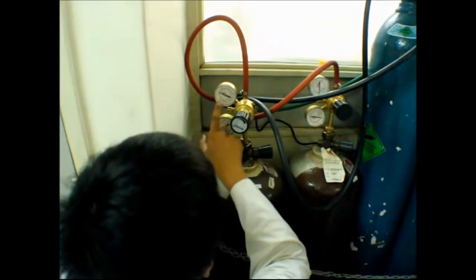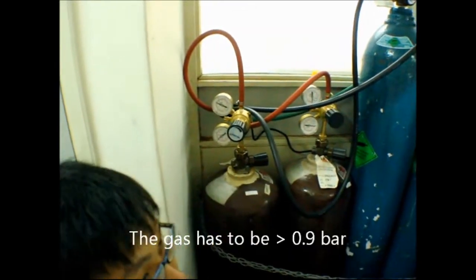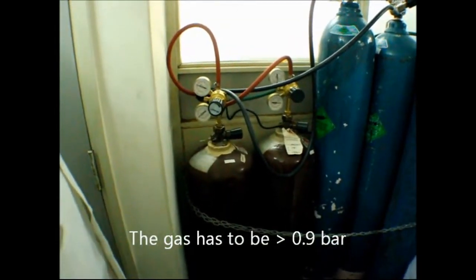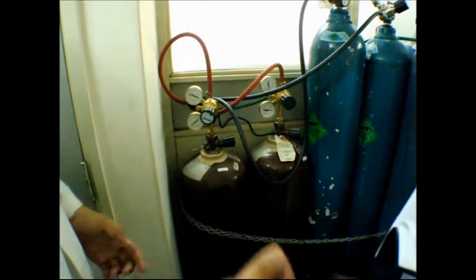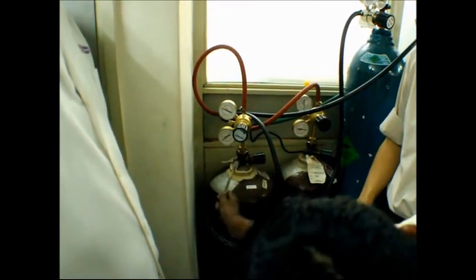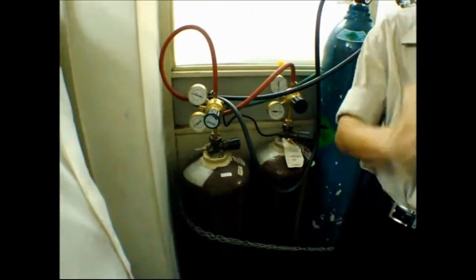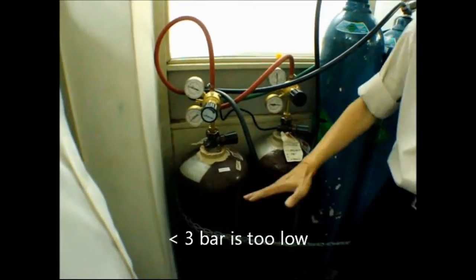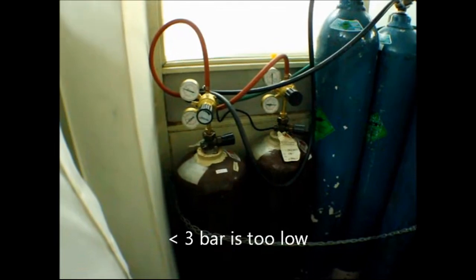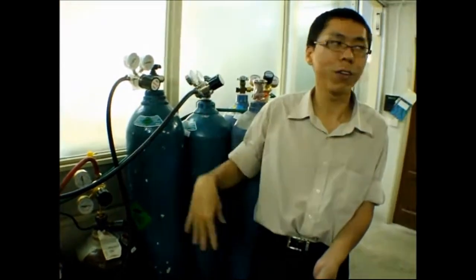0.9 what? Bar. It has to be more than 0.9. In this case, I think it should be okay because the engineer already tested. Do you have any marker pen? It depends on you. 1 bar maybe too low. Higher, 2 or 3. 3, or 5 is also fine. Why? Because at the bottom is not gas, it's liquid. If not mistaken, it's acetone. Then it will give you a lot of interference.